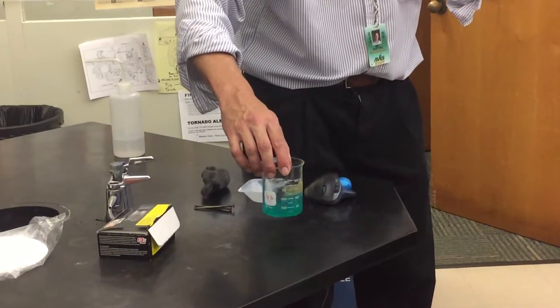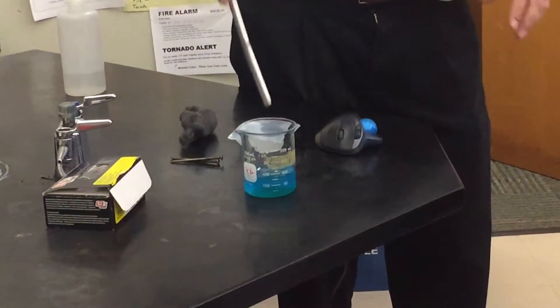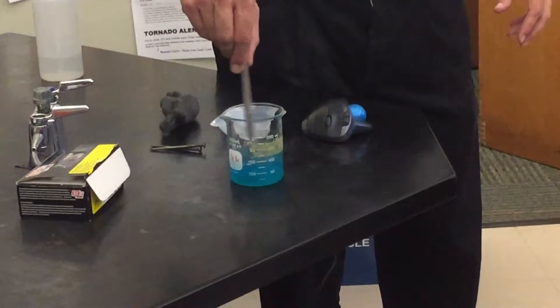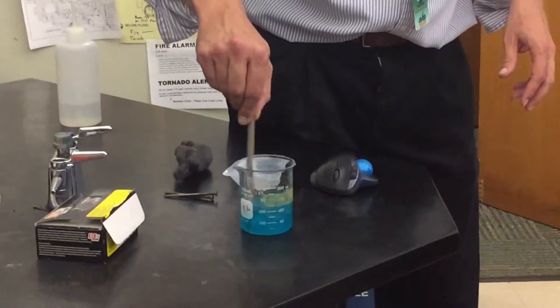One way is to do it this way, but it might spill a little bit if you do it that way. So, typically, take this and stir it up and get it nice and dissolved.